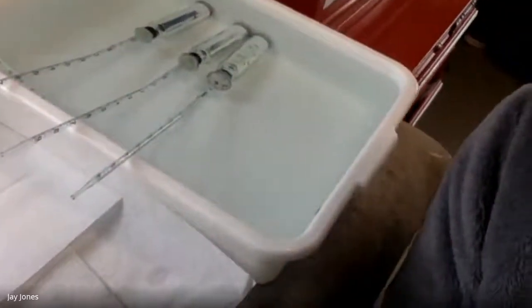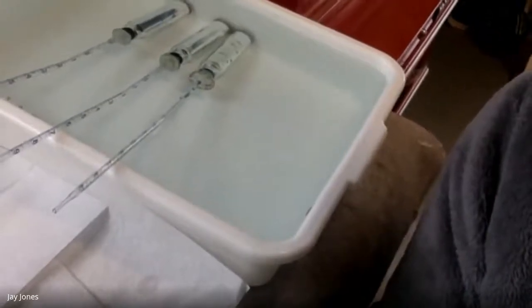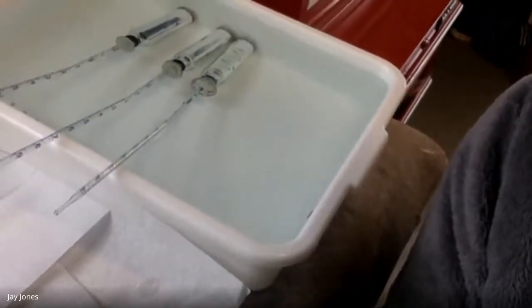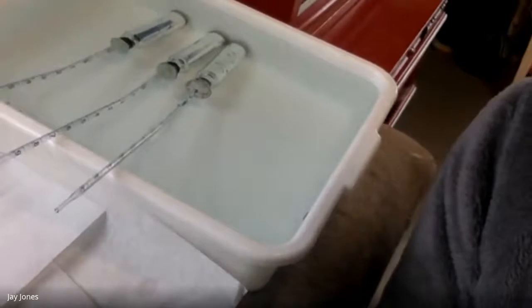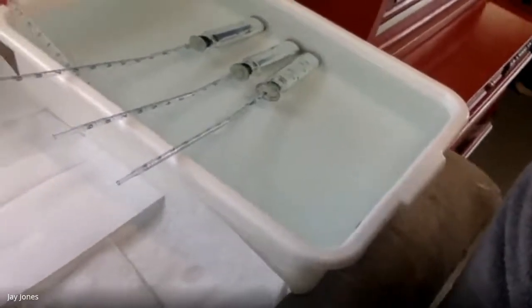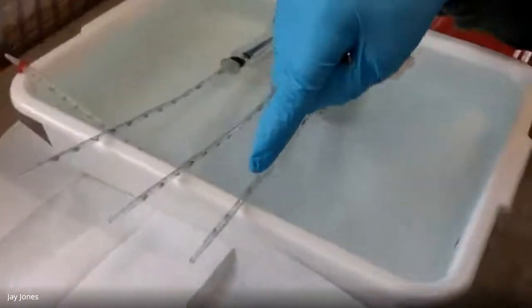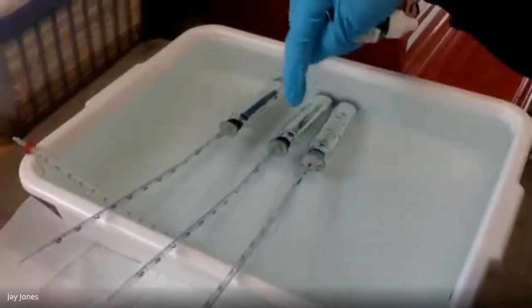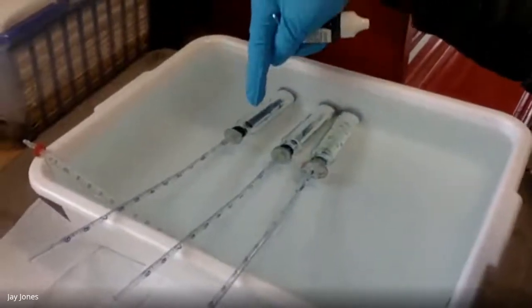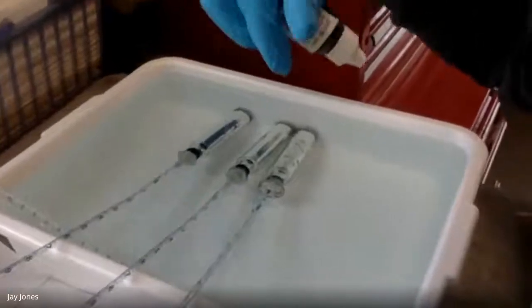But we're taking the CO2 out. The potassium hydroxide is reacting with the carbonic acid made by the CO2. So the CO2 is being taken out as a variable, and all that we're measuring is oxygen consumption by the peas, beads. I'll explain the beads in a minute.